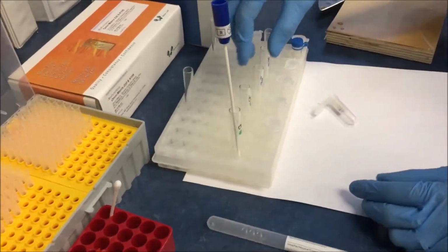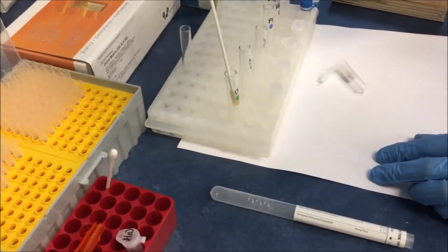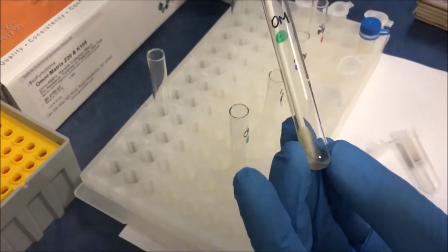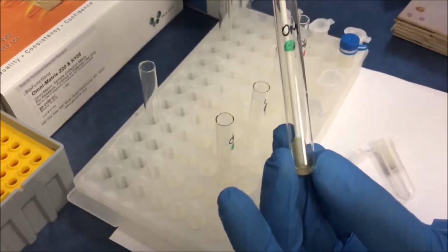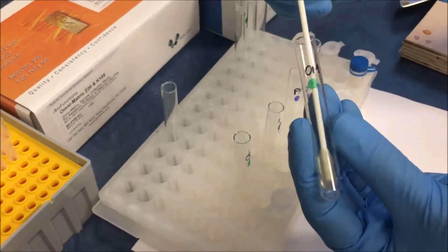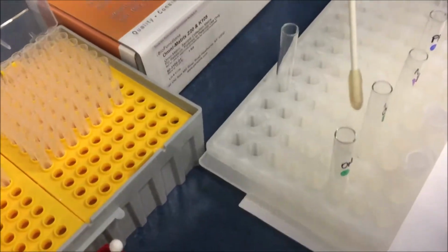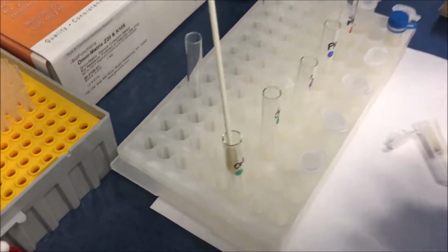In terms of the swab, we are going to show you, just pick up the tube itself, and you will see in the tube the color of the sample, the reddish tinge. The sample, in this case blood, the biological fluid, is now dissolved into the lysis buffer. And if we pull off the swab a little bit more, just to show you, there is no way that 100% of the biological material will be released from the swab.